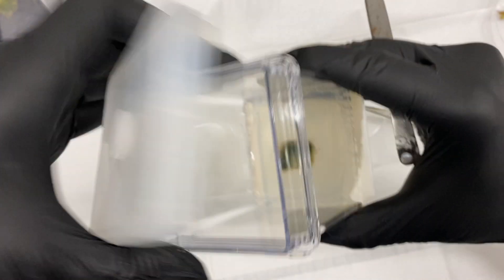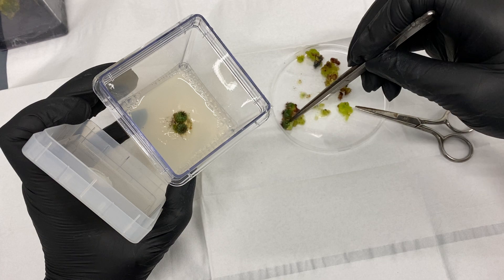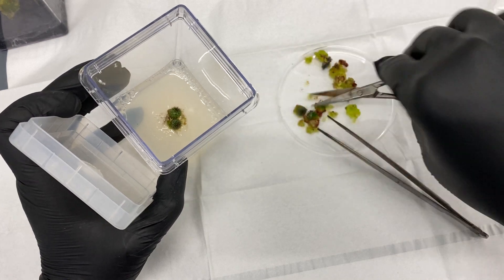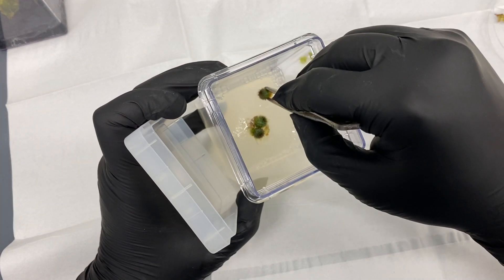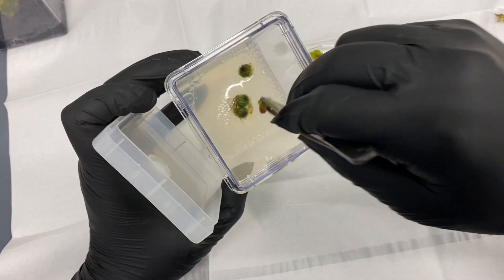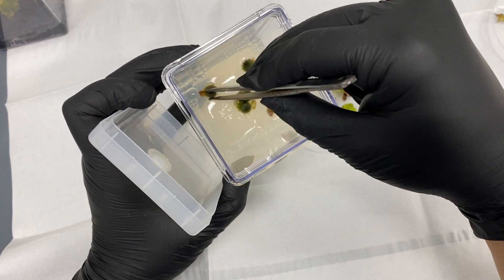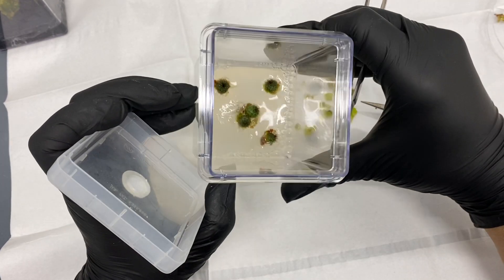You can separate them all out individually when you're really trying to increase your numbers, but I'm just doing a little bit of research right now. Hopefully available in the Etsy store soon enough — look at that, beautiful.